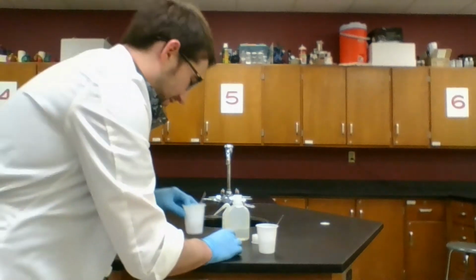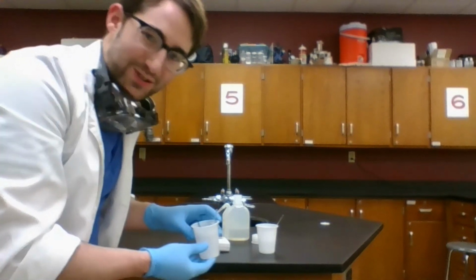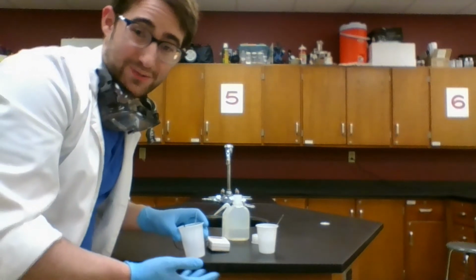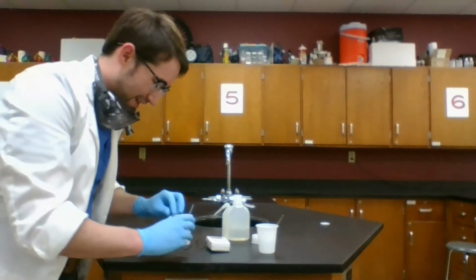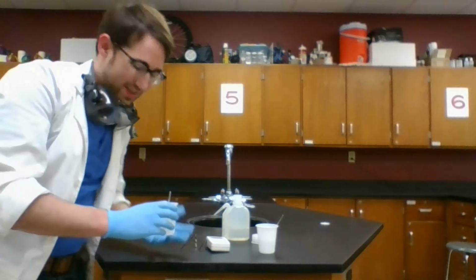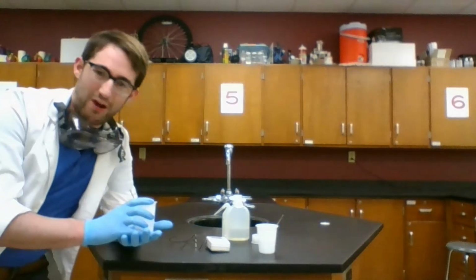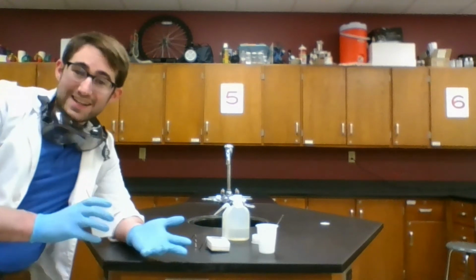If I feel the bottom of the cup, it's a little warm, and if I use more calcium chloride, I could probably get it up to maybe 40 degrees Celsius or even higher than that. So quite a bit of change. Now, I didn't place this on a heater or anything. There was a chemical change down here at the atomic level with that calcium chloride in the water where some things rearranged. That released heat in the process.